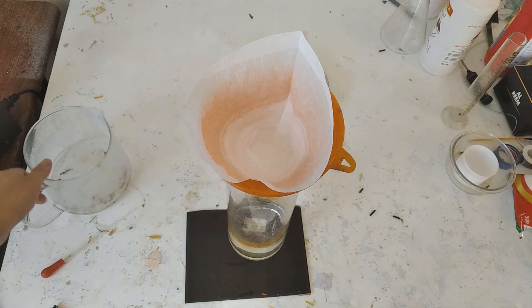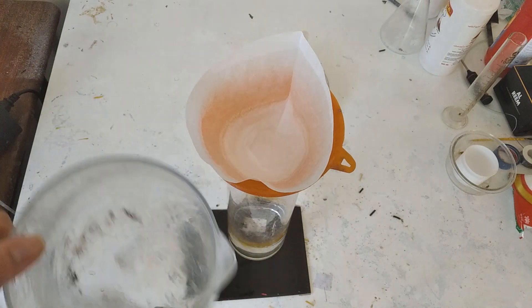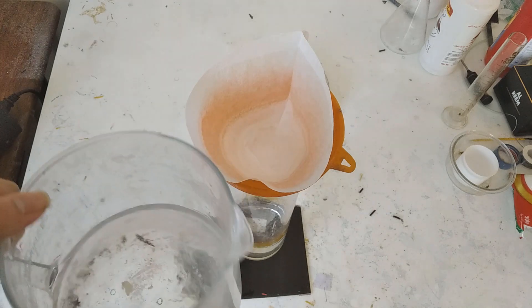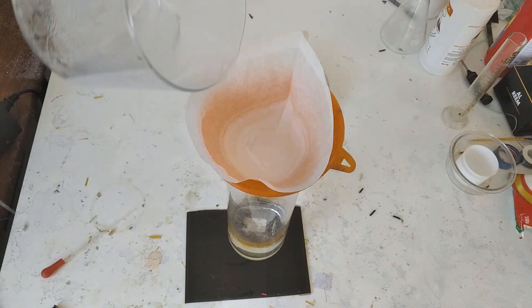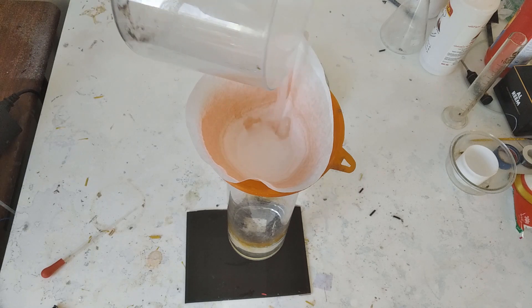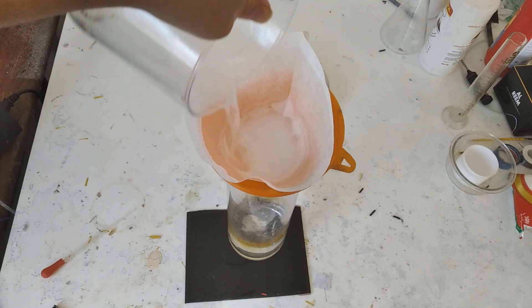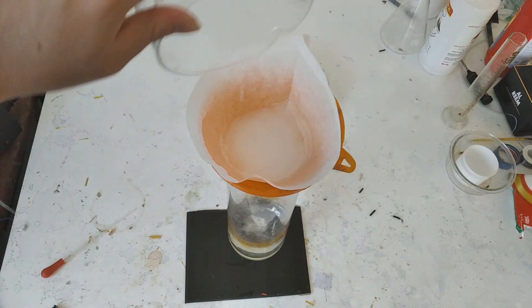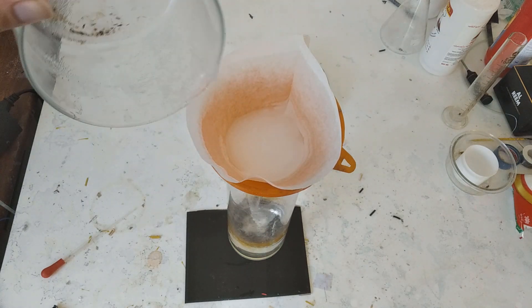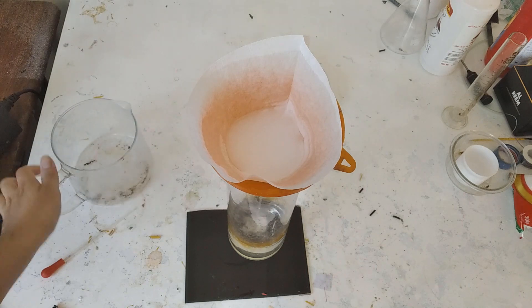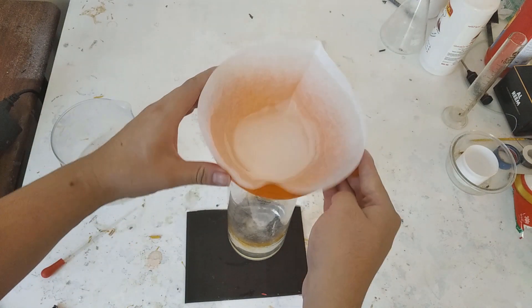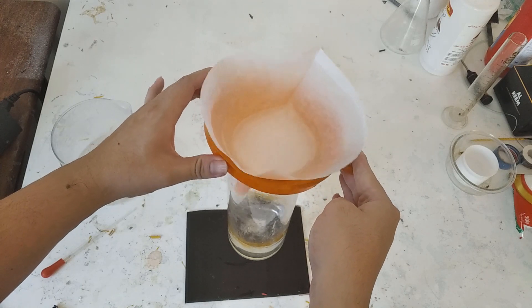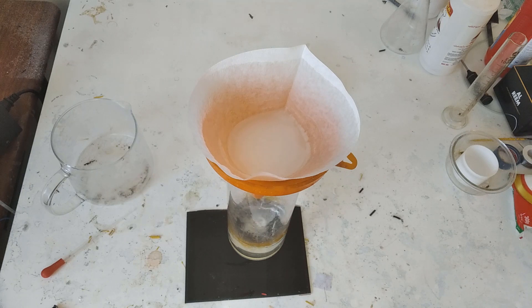Okay so we need to wash these crystals with some anhydrous ethanol because that will enable us to basically dry them faster because glutamic acid is not soluble in ethanol. Adding this, it also will soak into the paper and unlike water you can see ethanol drains a lot faster. All you wanna do is you just wanna soak everything just so that when it dries it dries very easily.